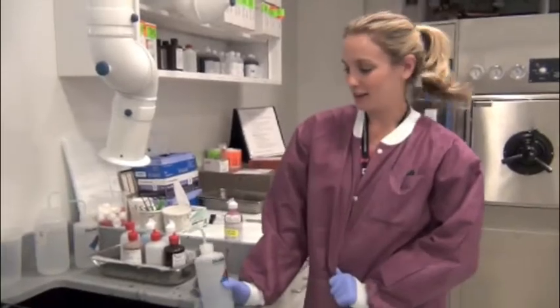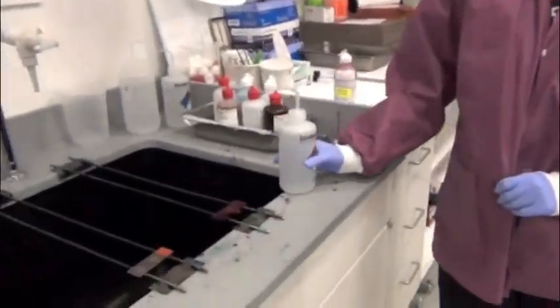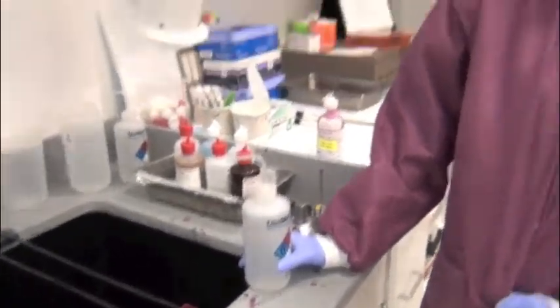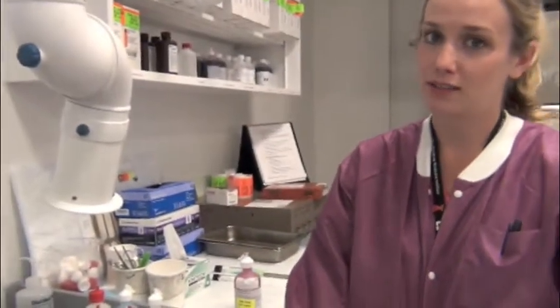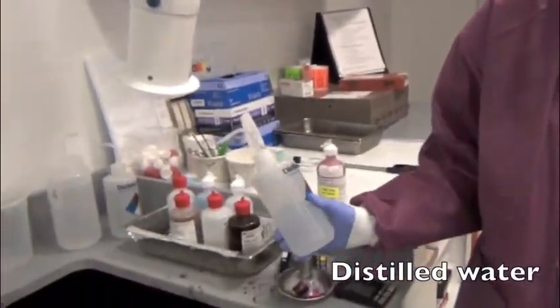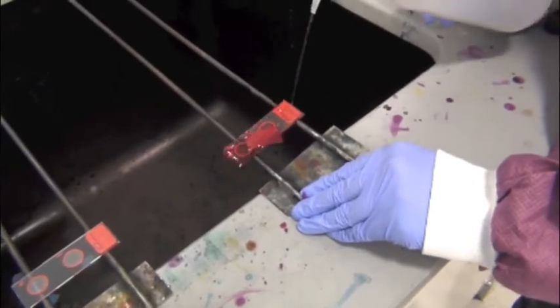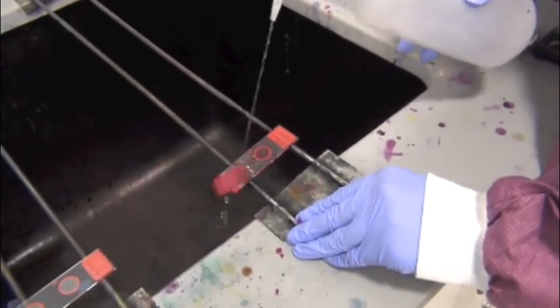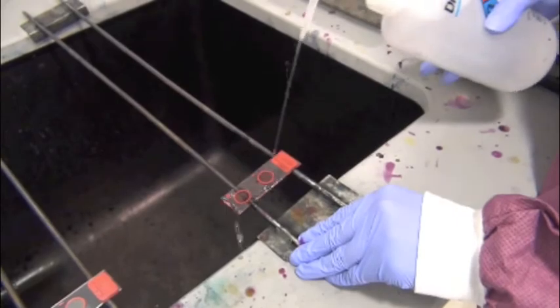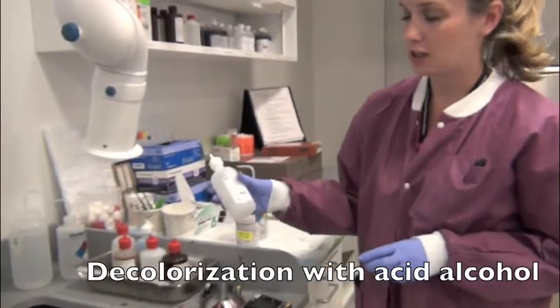After your stain has been on for 5 minutes, rinse with distilled water. It's important not to use tap water because it may contain environmental contaminants like Mycobacterium gordonae, which could lead to a false positive. So we use distilled water and we go gently around the edges. At this time, your filter paper can come off because we're not worried about crystals from any of the other reagents. Next, we use a decolorizer.